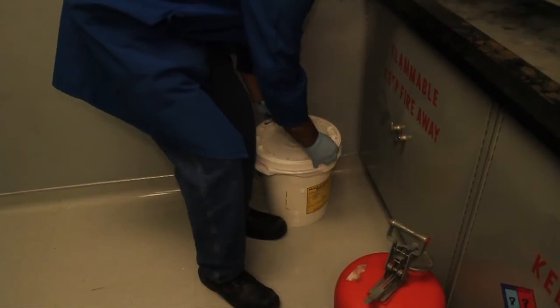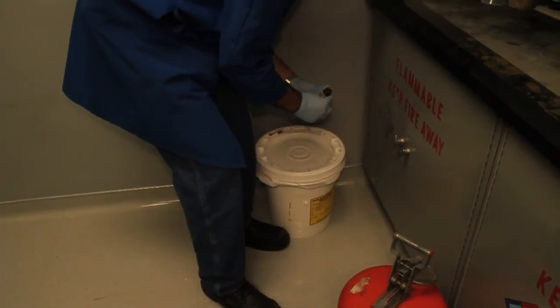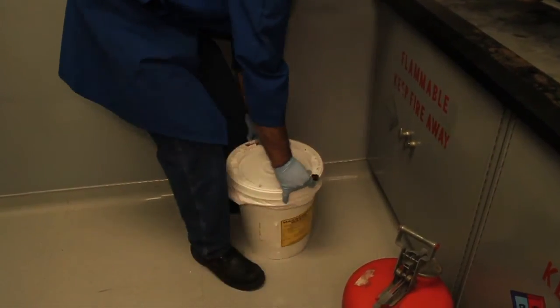Make sure to remove the lid and place the empty container into the organic debris waste container.